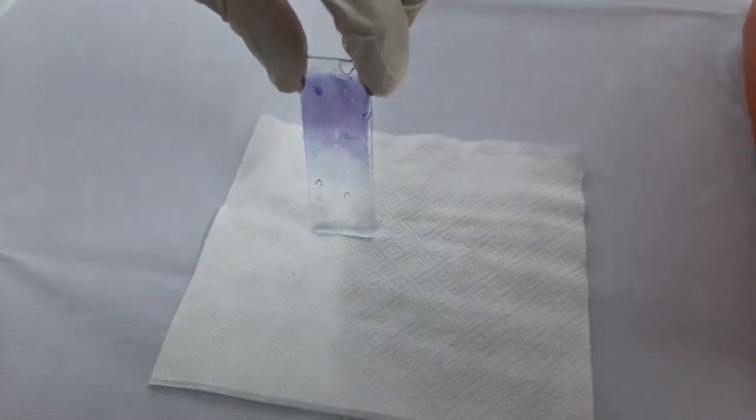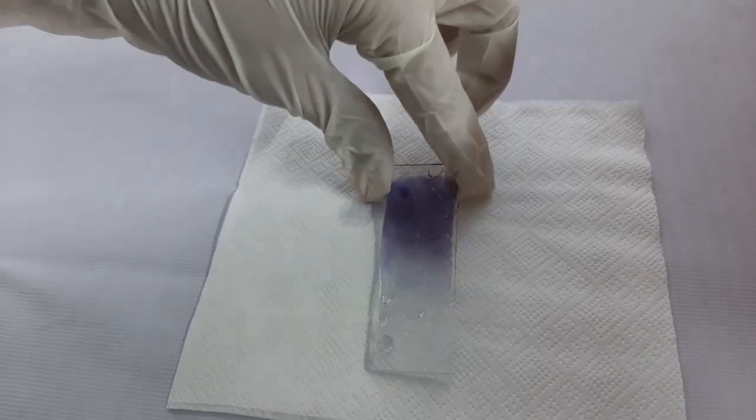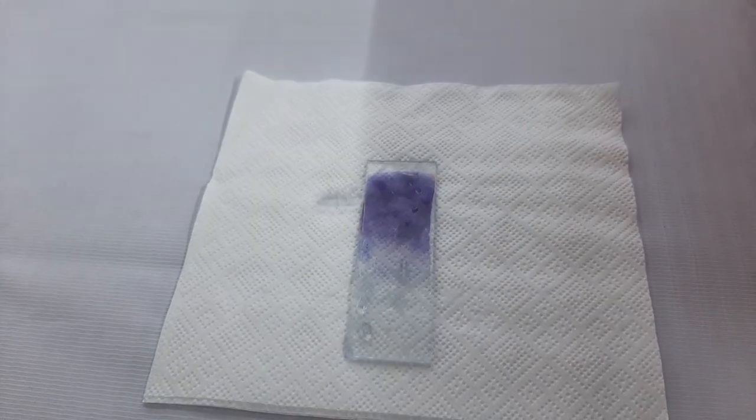And then place the slide on a clean and dry tissue paper and allow it to air dry.